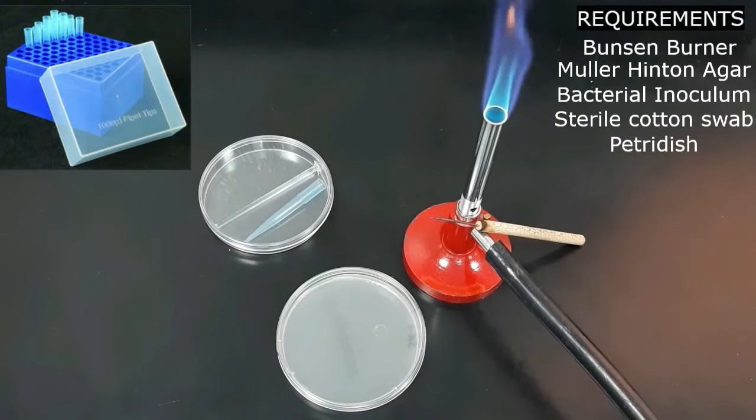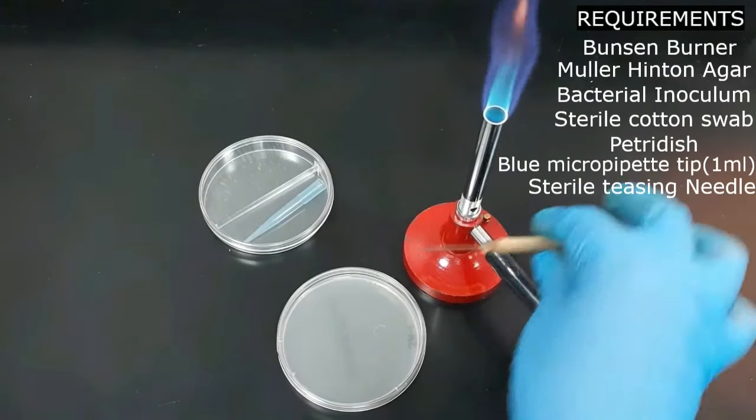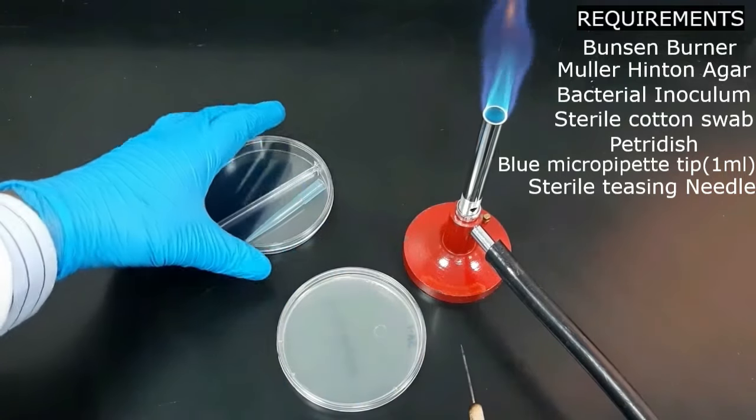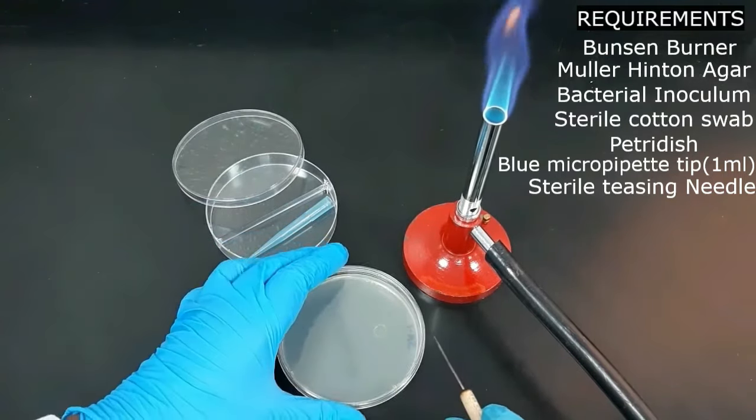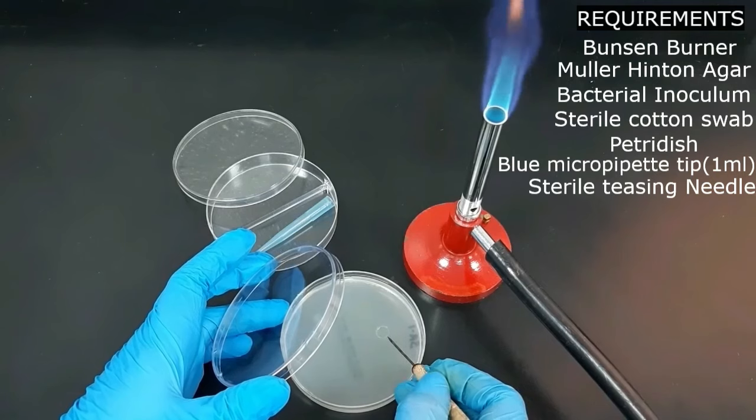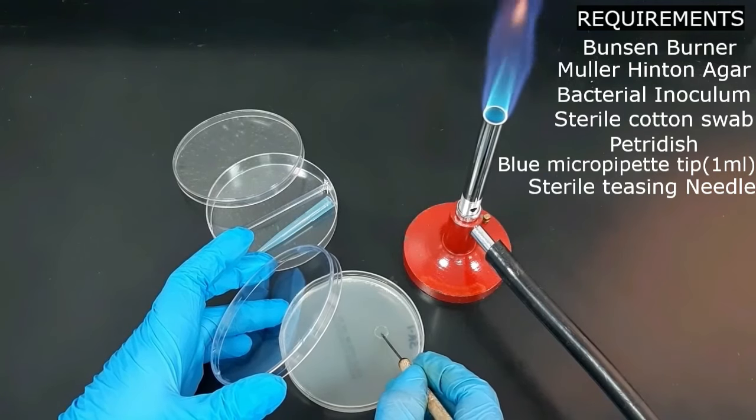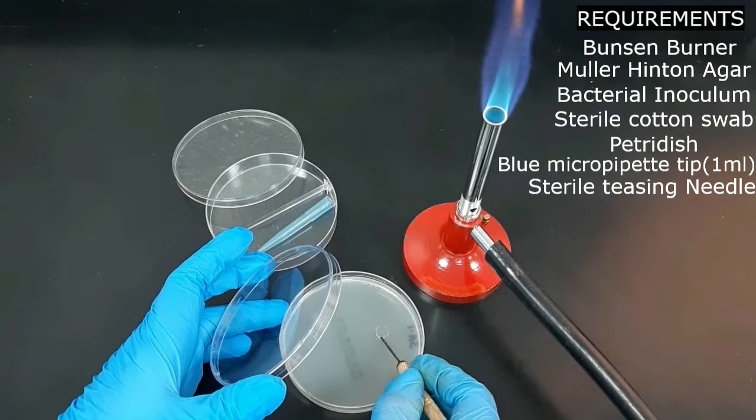Mostly when removing the tip from the punctured area, the agar will also be removed. But sometimes the agar medium will not remove easily. In that case, remove the media with the help of a sterile teasing needle.